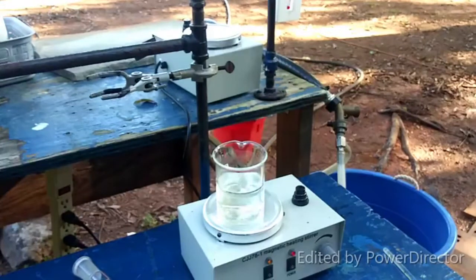We'll see what we get when this evaporates down. I will come back when there is something to report.